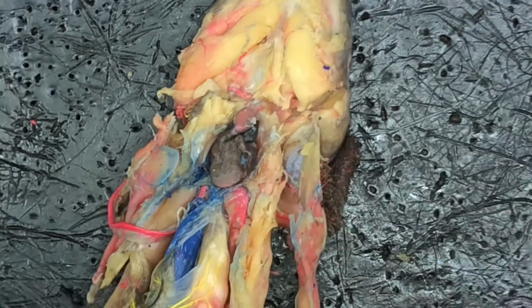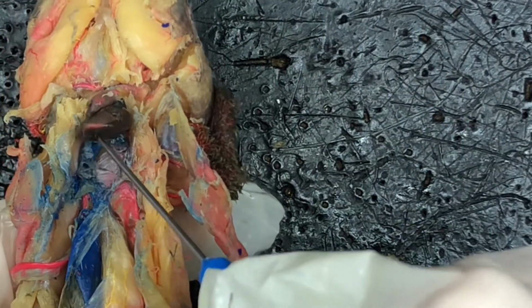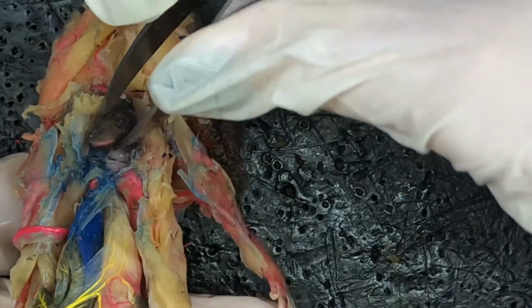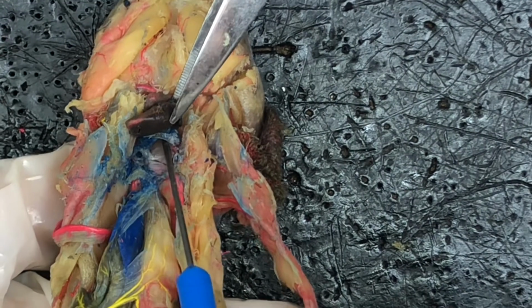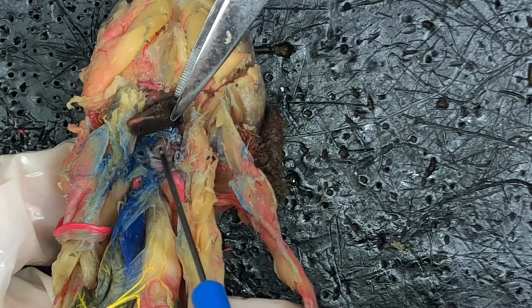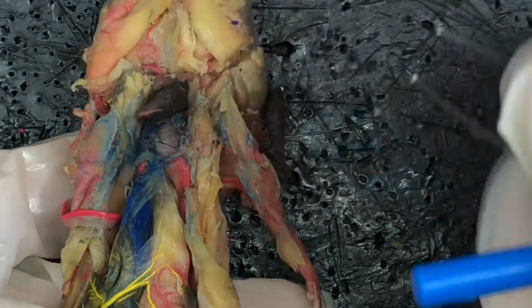And then we have the sinus venosus, which is where blood is going to collect. Let's see if I can pull this back a bit. So the sinus venosus would be right in here. And then the hepatic sinuses are on both sides of it, here and here. Blood is going to collect in the sinus venosus right here. And then remember, the hepatic sinuses are on both sides of that.